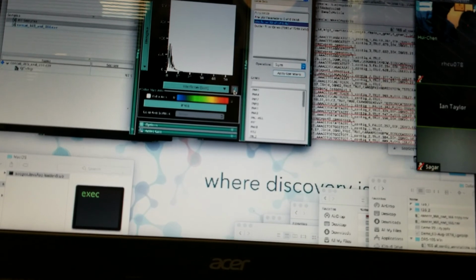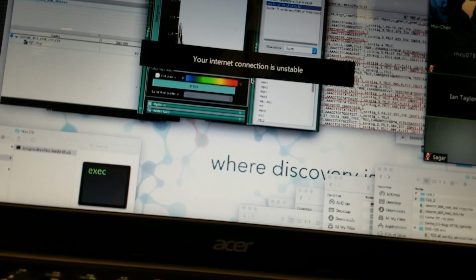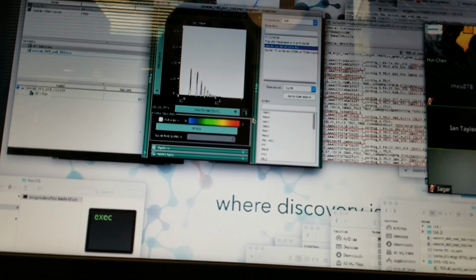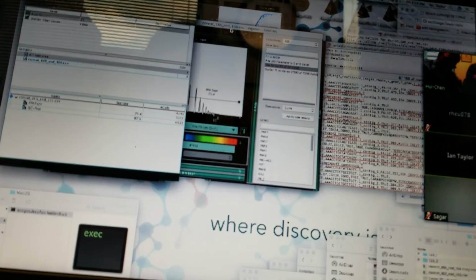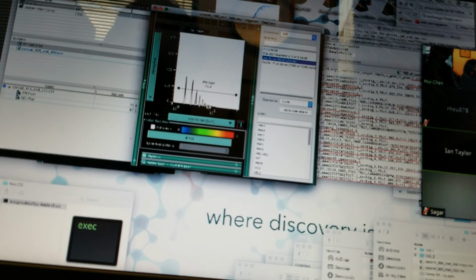And then it looks like it might look better on a log axis. Right, so that's what I've switched to. And now I could gate on anything expressing more than one IFN. And that's a huge amount of data, actually. Looks like 71% of the data has some IFN expression.